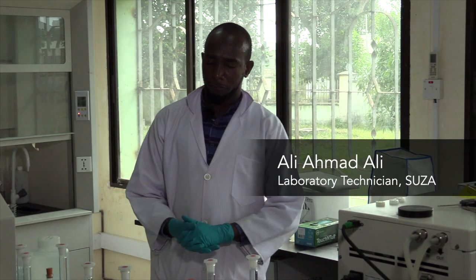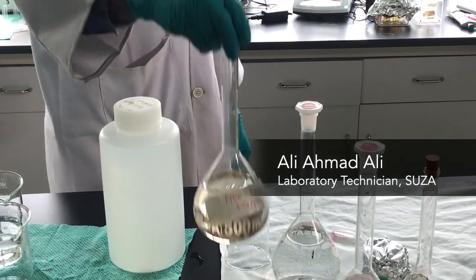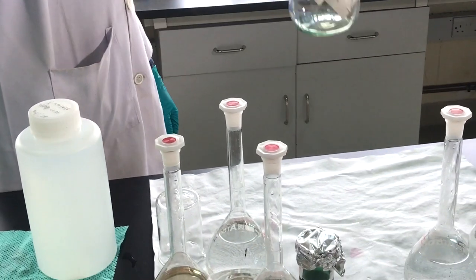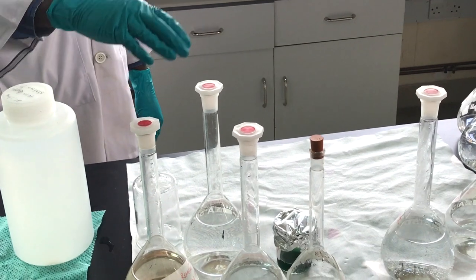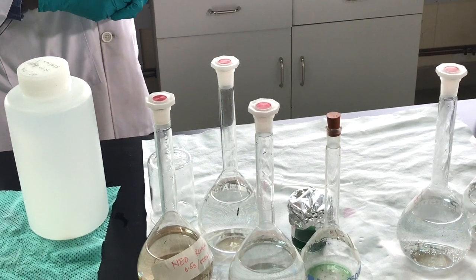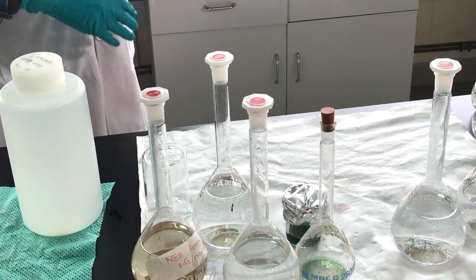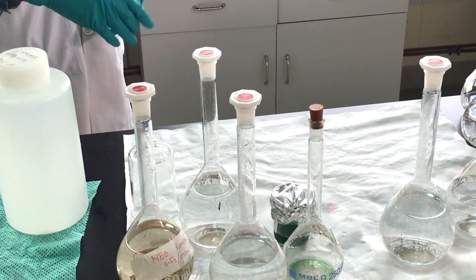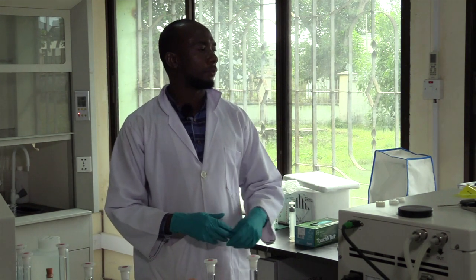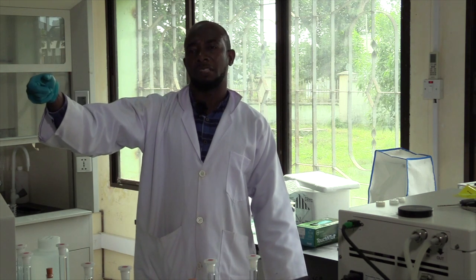Here we have standards and also reagents. The reagents have been prepared previously to save time. Using these standards, we measure different concentrations and put them in test tubes, then place them in a water bath for 30 minutes. After 30 minutes, we take our test tubes, put the standard into cuvettes, and the cuvettes are introduced to the spectrophotometer for reading.